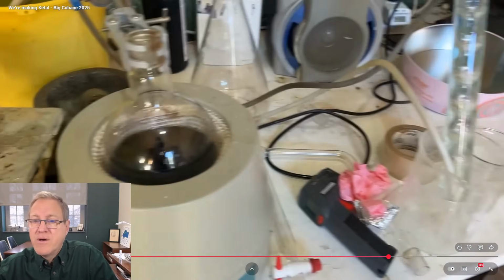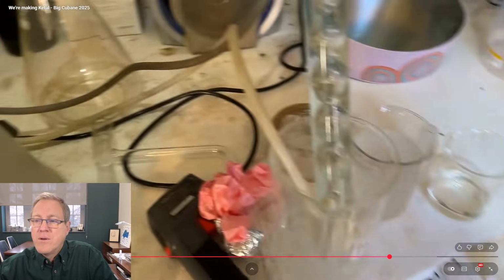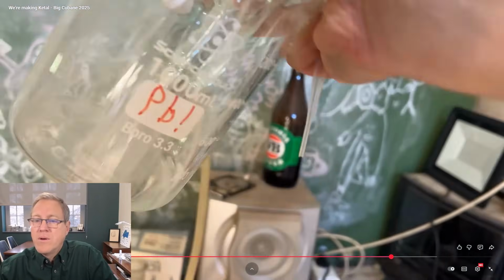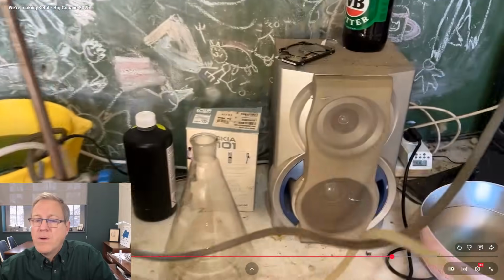Good. Drips of water into the reaction mix just now. I thought that was pretty weird. I thought, where was that water coming from? It is the cooling water. You can see that green colour? See, it's why you dye your cooling water. Once again, this is not lead, but we can see the green colour of the cooling water. That's a bit of a shame.